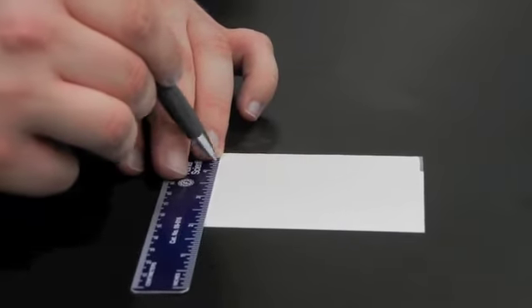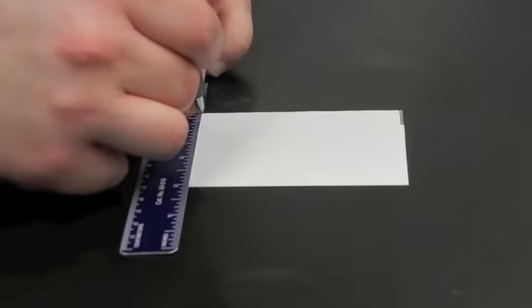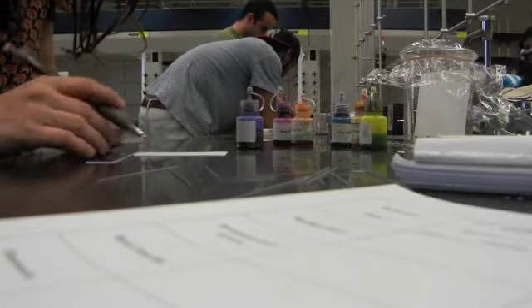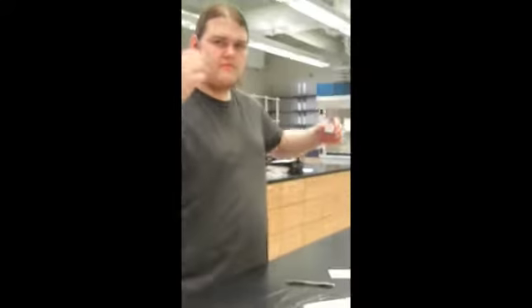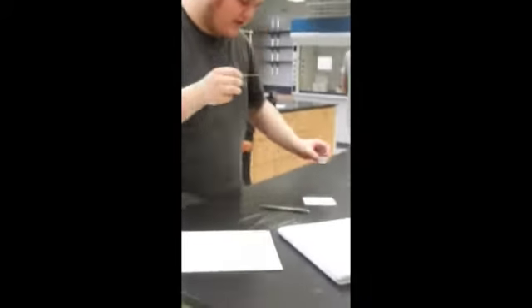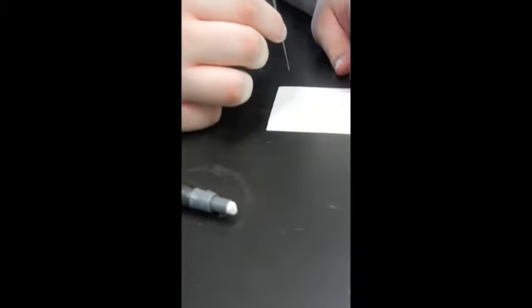First, a horizontal line is drawn on the bottom of both me and my partner's chromatography paper. Then small drops of each of the dyes in the unknown dye are added to the line on the bottom of the paper with capillary tubes, making sure to secure ample separation between dyes. The chromatography paper is placed in a small amount of nonpolar solvent, making sure the solvent does not touch the bottom line on the paper.